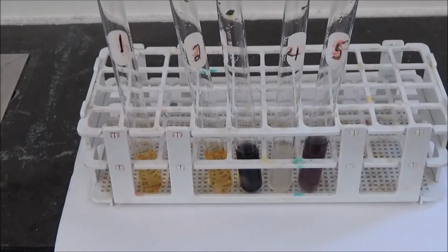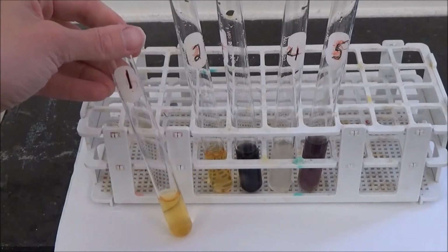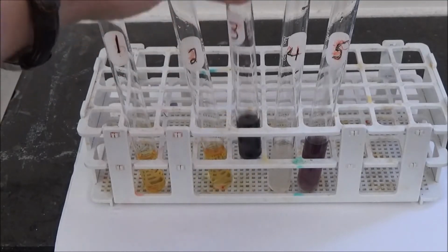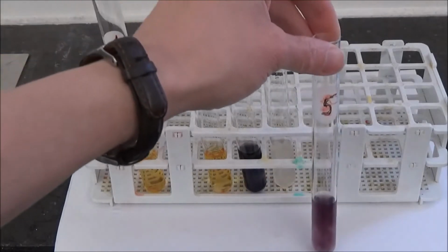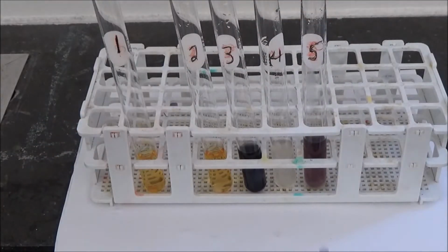The 15 drops of iodine have been added to each test tube, and I've placed the test tubes on a piece of white paper so you can see the color better. You're going to want to record the final color of the solution in each test tube in table 1 on page 39. Here's tube 1, tube 2, tube 3, tube 4, and tube 5. Which tubes are positive for starch?